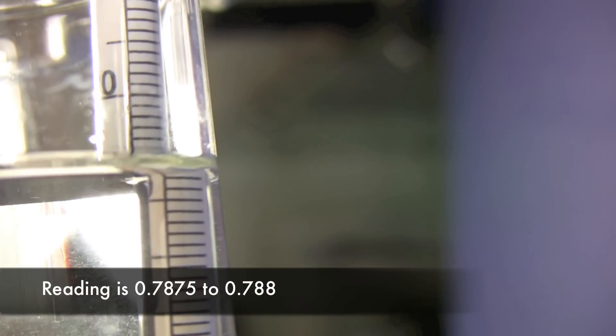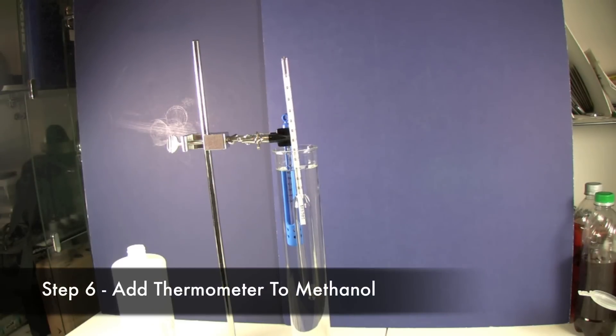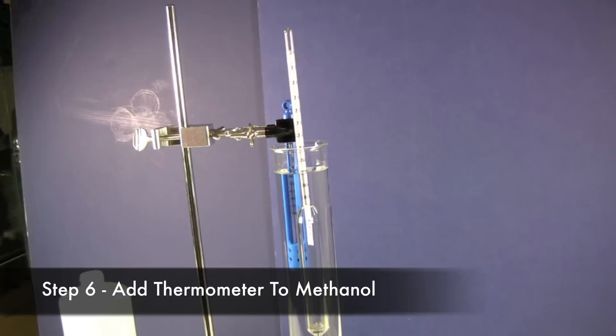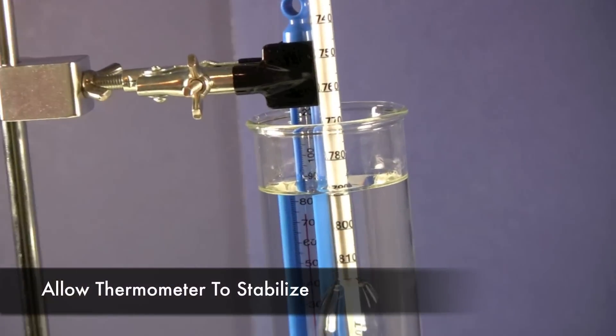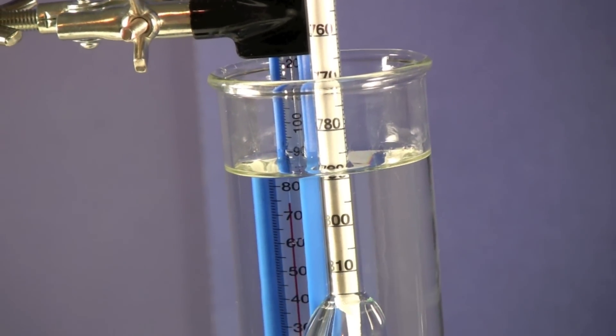So I've mounted a thermometer, which we get with our ultimate methanol test kit into this methanol test. And we're going to just let it kind of stabilize here and see what the temperature comes up at.